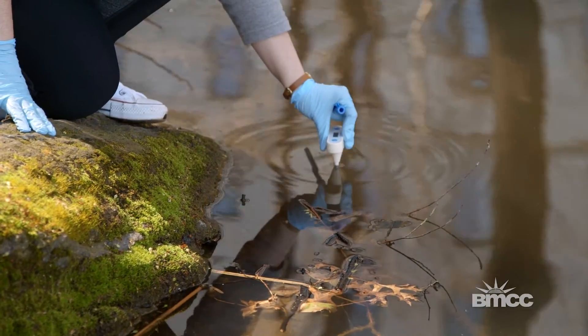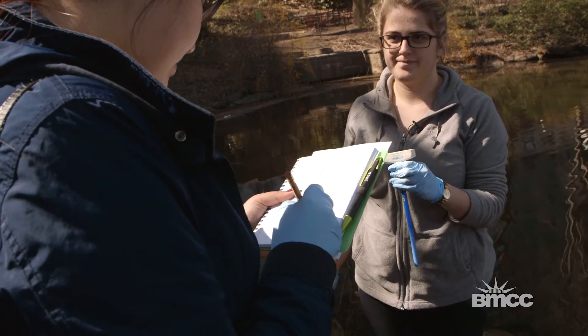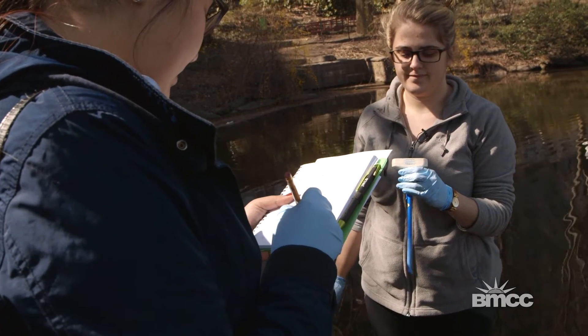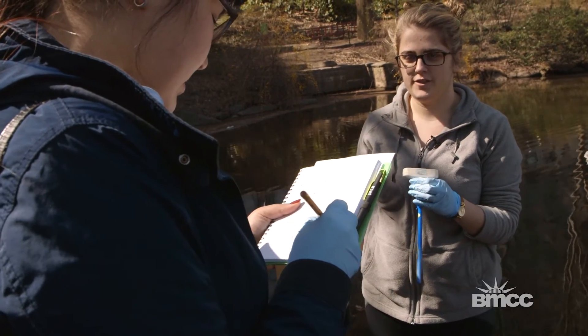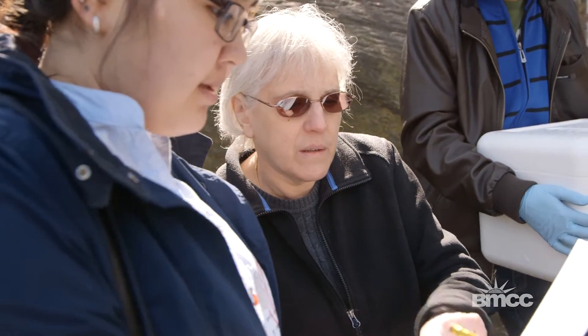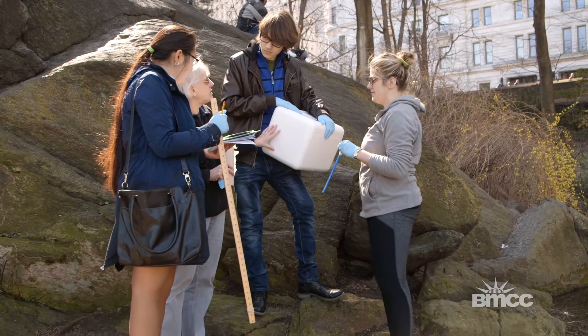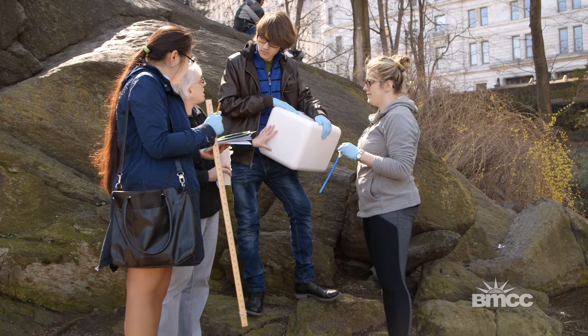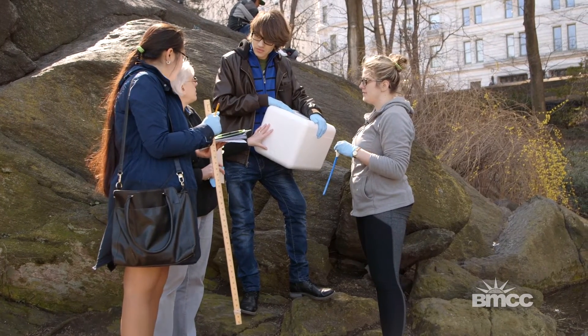We're starting with a protocol that the Environmental Protection Agency uses to screen for E. coli contamination in water. We're not really so much looking for contamination, although we can, but it's one way of teaching the students how to identify bacteria and how to do a lot of these biochemical tests.